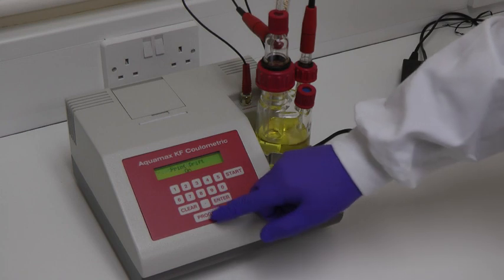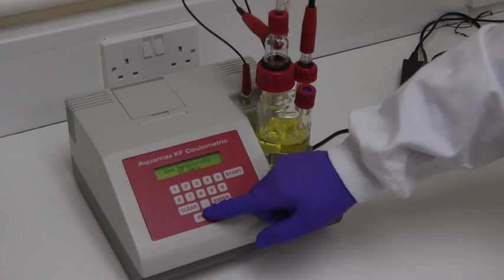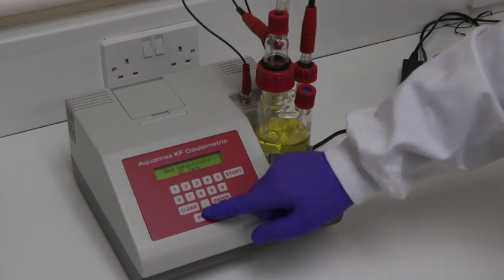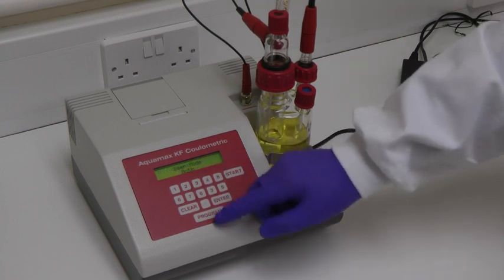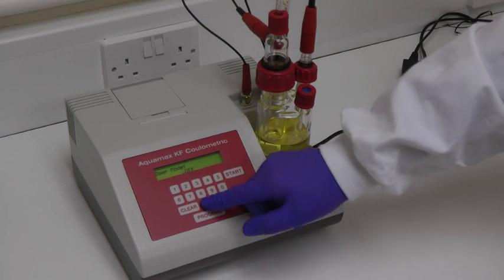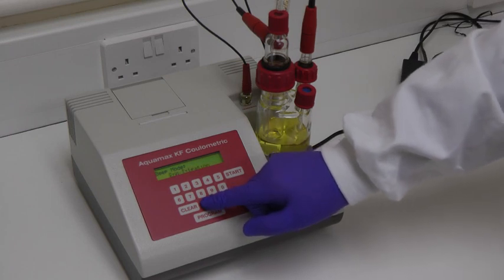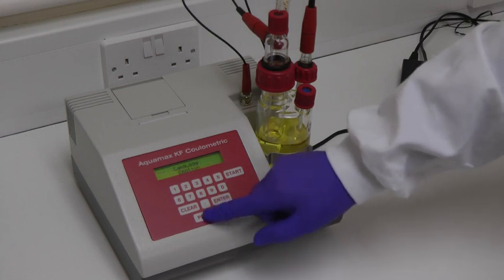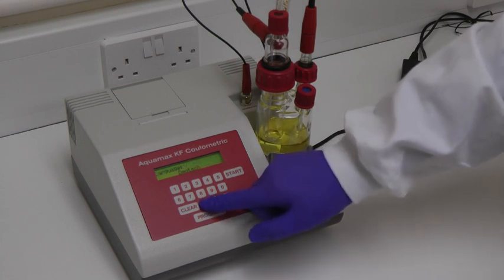Other parameters allow delay times to be programmed, minimum titration times to be set, and the sensitivity to be changed. The beep can be turned off, set to sound when a key is pressed, to the end of titration, or to both. The user's language can be selected from a list of all common languages.